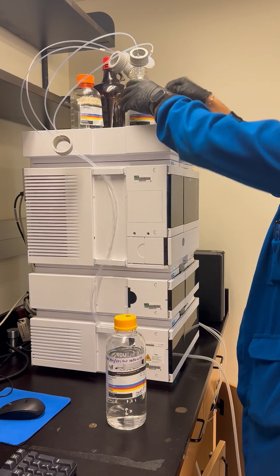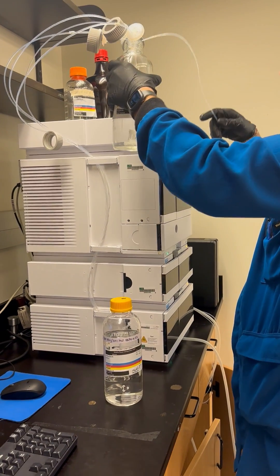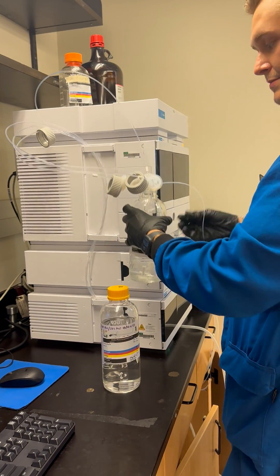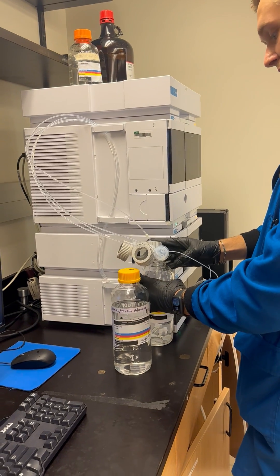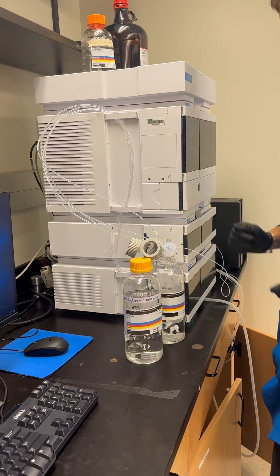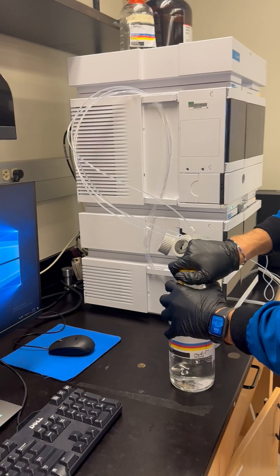So what we want to do is first, I'm tall so I can access everything from up top here. Most people won't, and for safety, let's have everything working at a comfortable level.